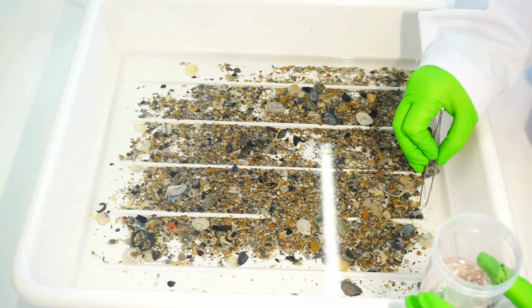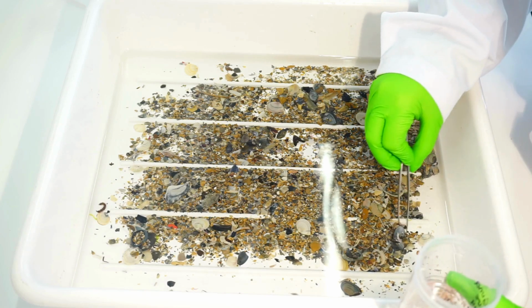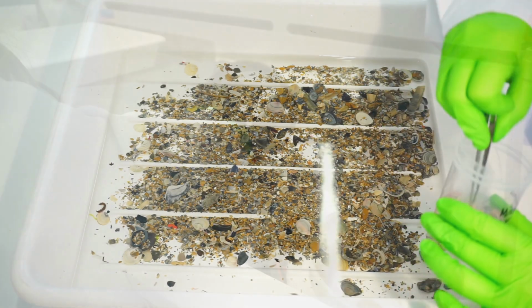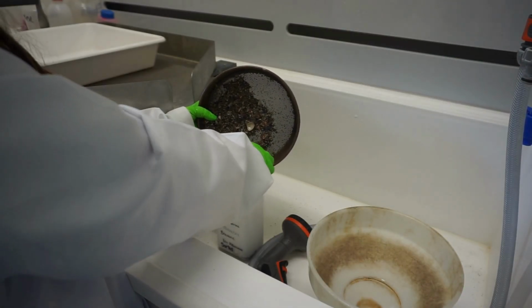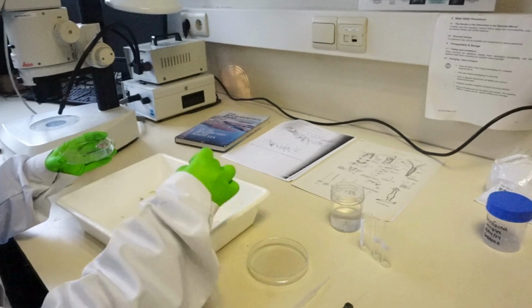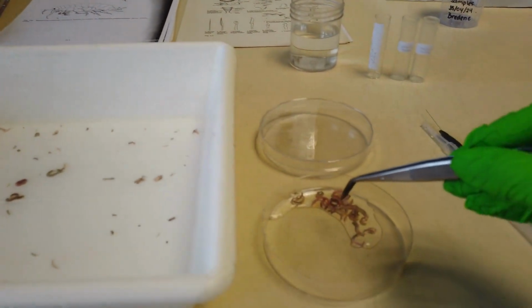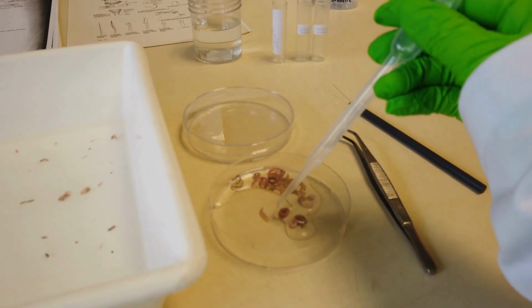The macrofauna is picked out with tweezers and stored in 70% ethanol for short-term analysis or 8% formaldehyde for longer storage. The remaining sample is stored in 70% ethanol. In the case of a large number of organisms, they should be transferred to a sorting tray for taxonomic separation. The organisms of the same taxa are placed in a petri dish or a gridded counting dish with water.